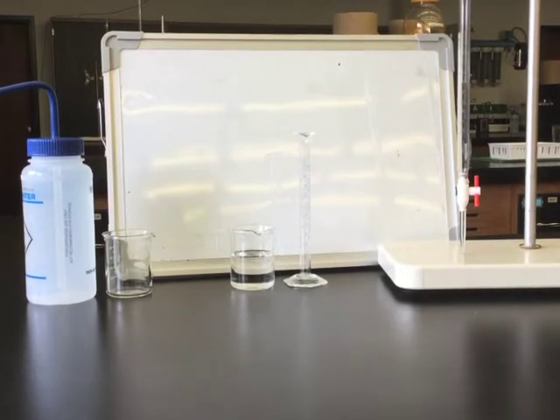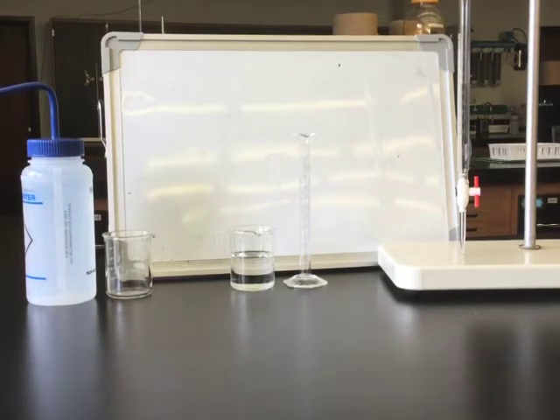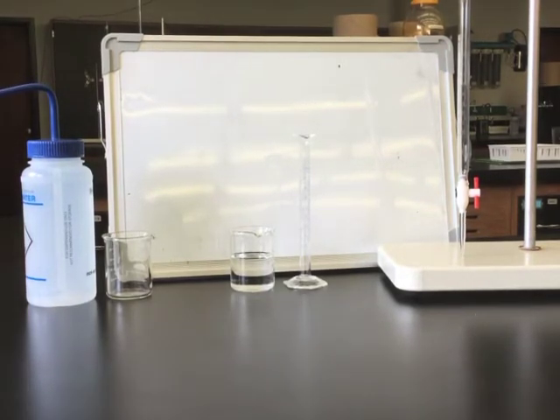For density, you will need both the volume and the mass. We will use an analytical balance to find the mass, and in one case we will use a graduated cylinder and the other a burette to find the volume.